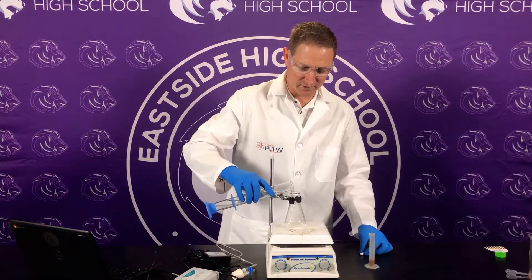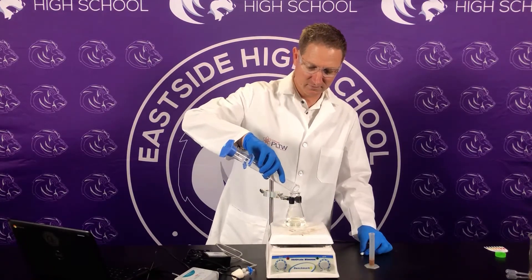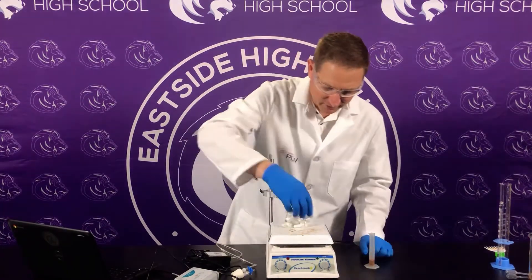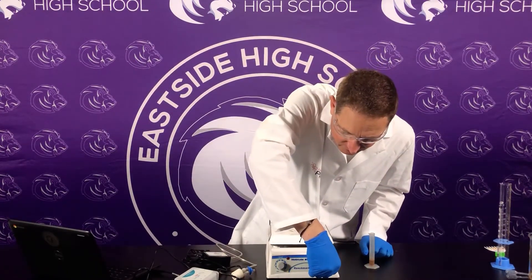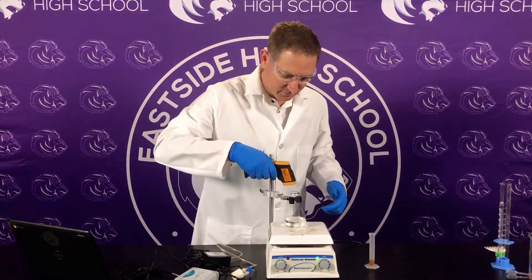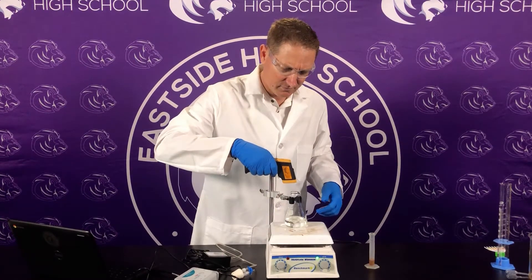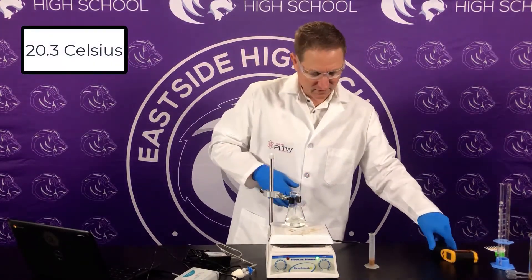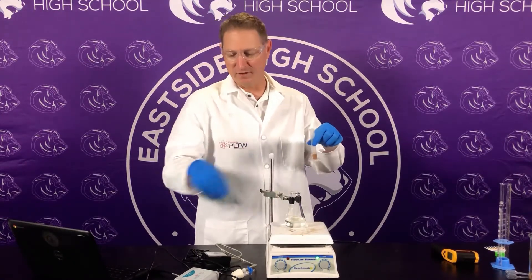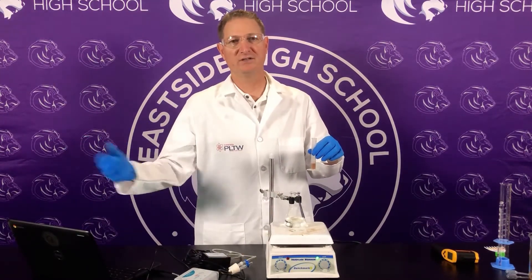This is 50 ml of that solution. I go ahead and put it in, put my stir bar in, and like everything else I'm going to turn it up to 5. I'm going to take the temperature — 20.3, consistent with the baseline. Now I'm going to take my 2 ml of catalase, put it in, make sure my stopper is closed so I can collect the pressure. Collect for 200 seconds.